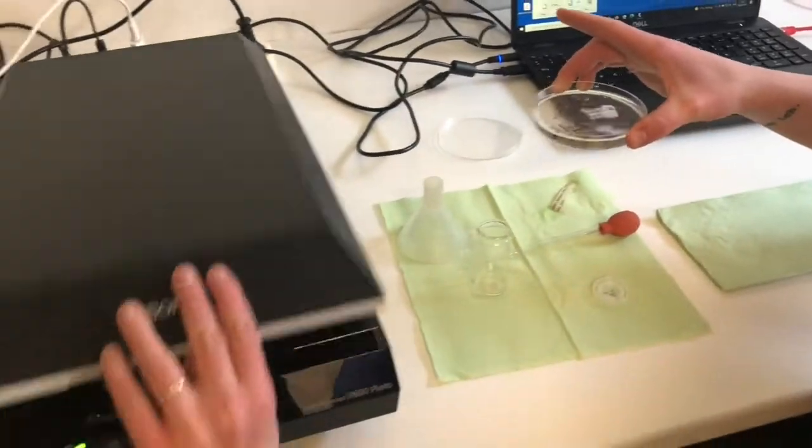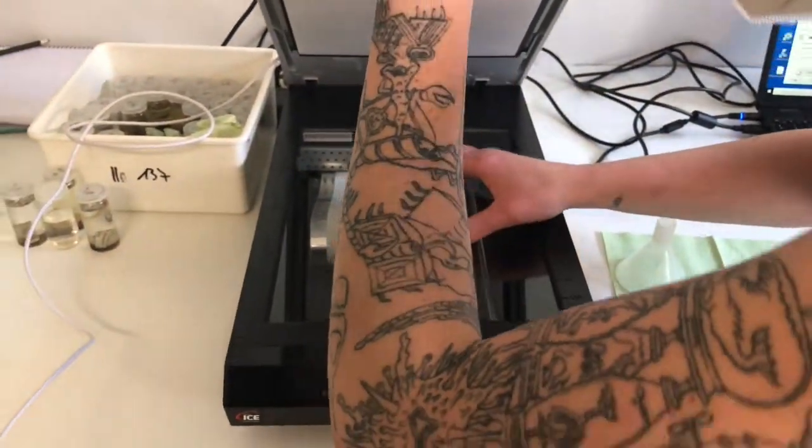After all animals are transferred, we put the petri dish in the scanner.